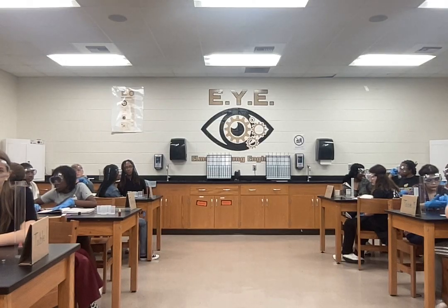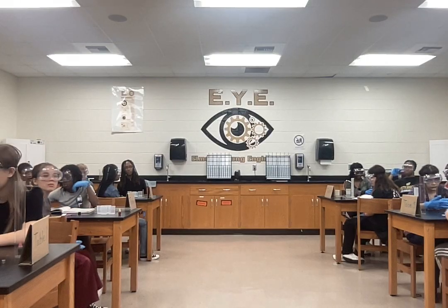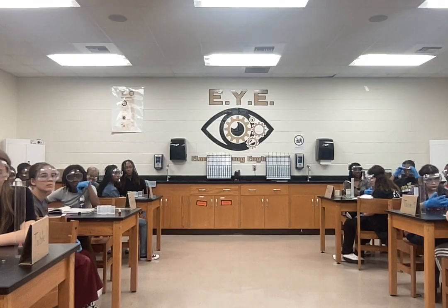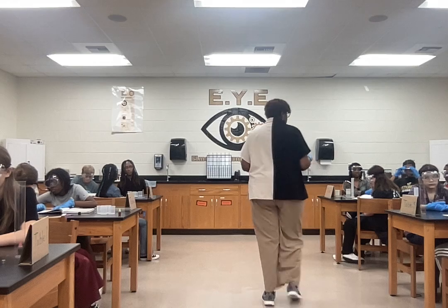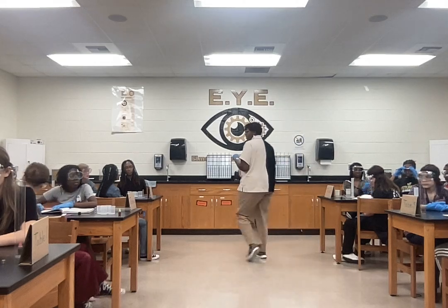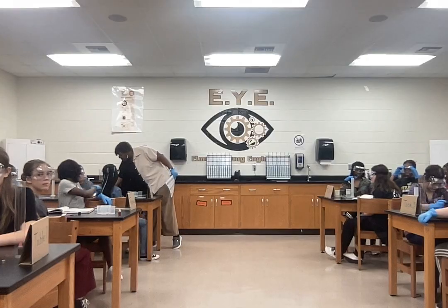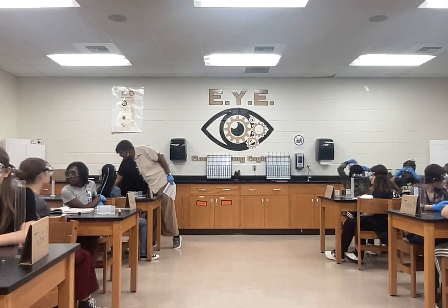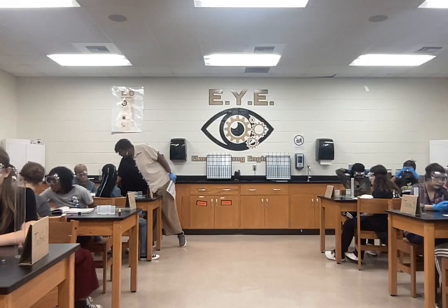Okay, so we get 39.58 for that second column when we have 25 milliliters of water. Does that make sense? 39.58. Do we have questions on how we got that number? So you're going to put it right here. This mass will stay the same because it's the mass of the cylinder by itself.